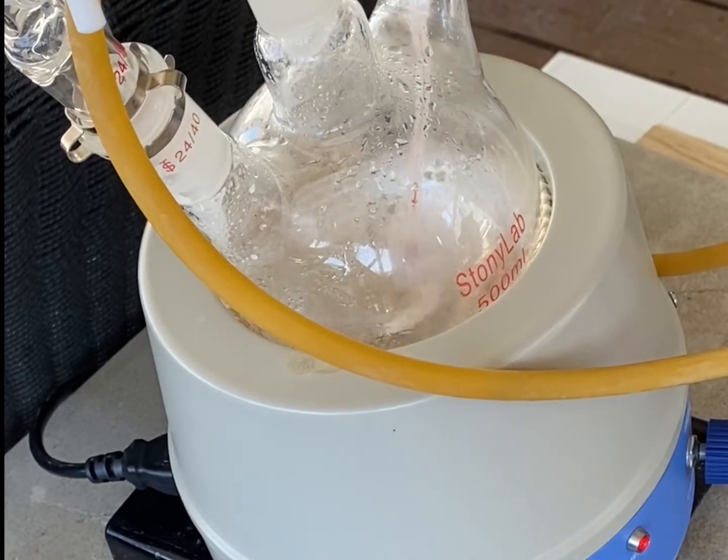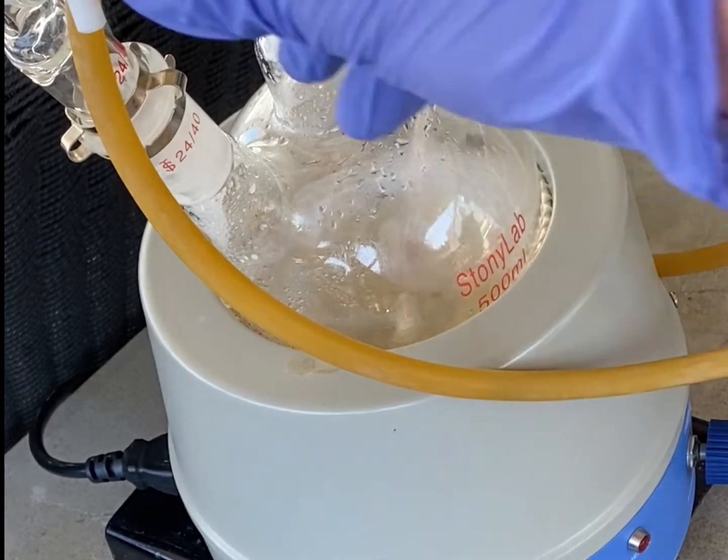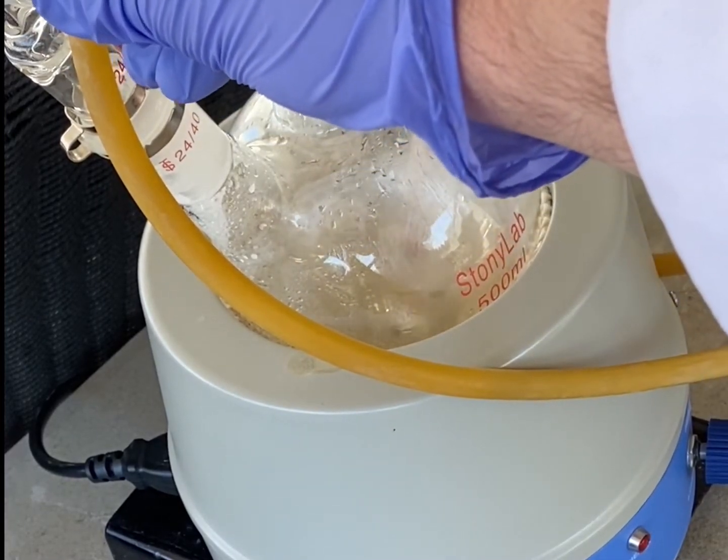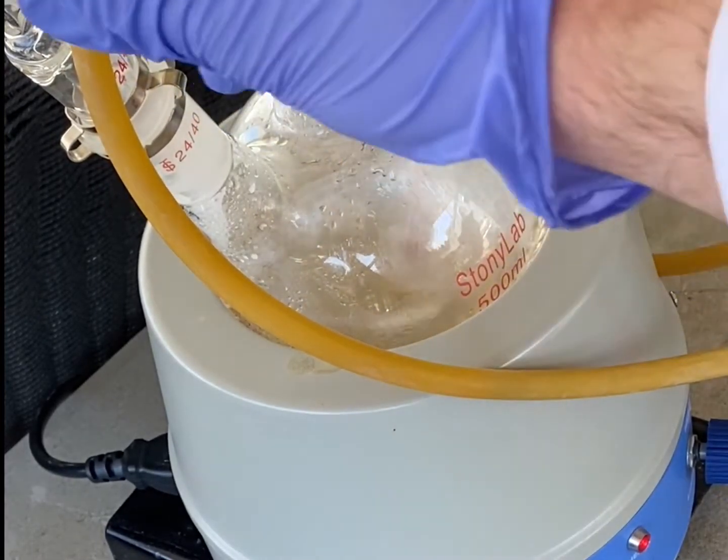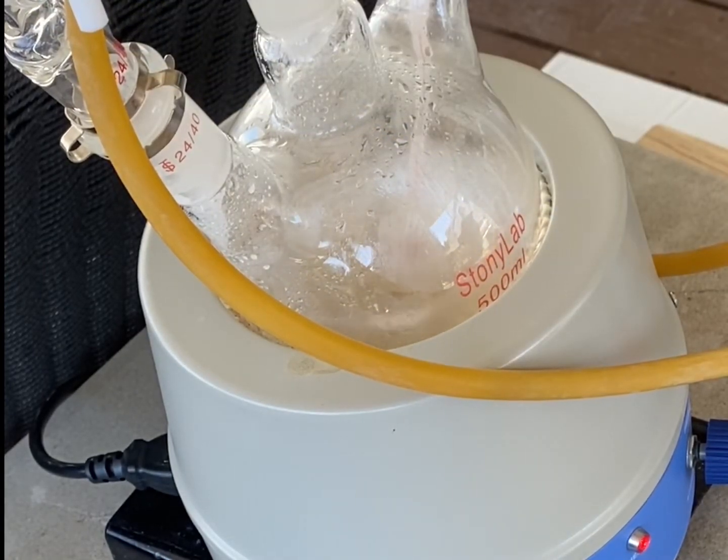And as you can see, on addition of the sulfuric acid, the solution begins to change color from a clear liquid to a dark solution.